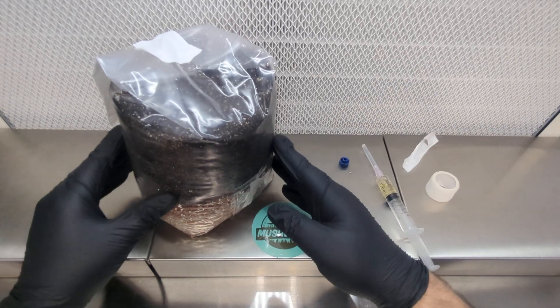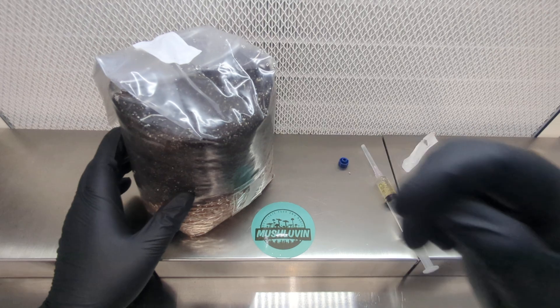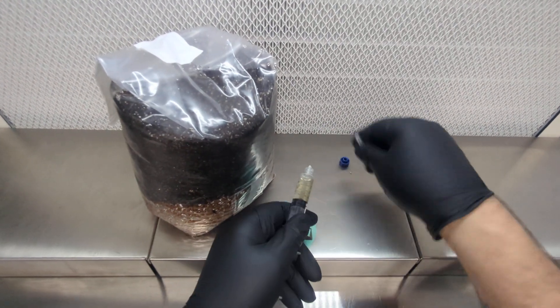And that's pretty much it. About maybe four weeks from now, three or four weeks depending on the strain, we'll be able to do a break and shake and we'll have some videos on how to do that in the future.